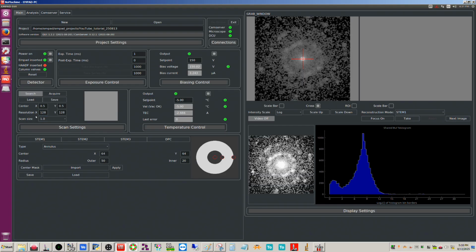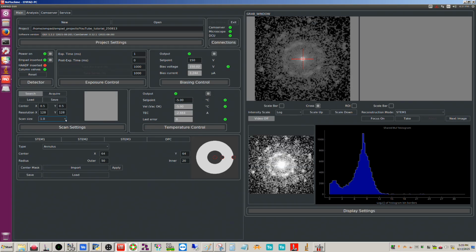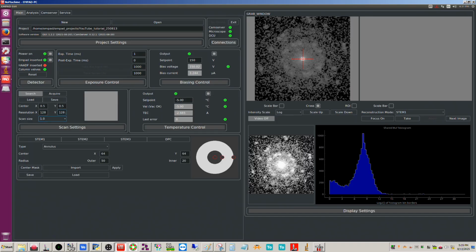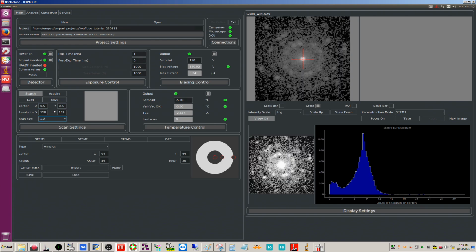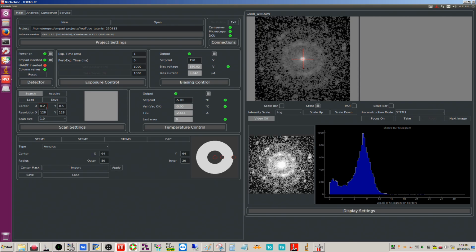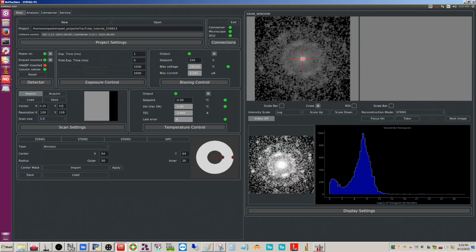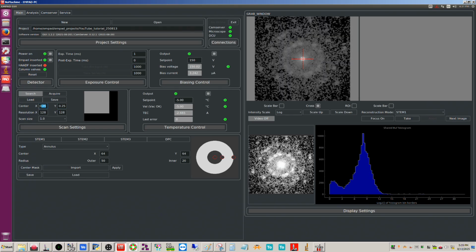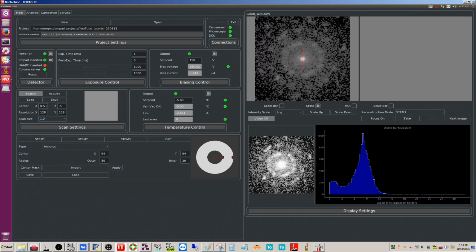So what you're seeing here is the scan size. This is the full frame, the 1.0. You can change this, but it's most intuitive to just leave this on 1. And this is the scan resolution, so it's a square. This is the same field of view that we were getting in Velox. This is the center position of the scan, so this would be dead center. You can adjust this, it's kind of weird if you do, but you can see what happened: it actually shifted a little bit to the left. It's showing that the scan area is now not centered. So the best thing is I would leave this centered. Make sure you hit enter with each of these. There we go.